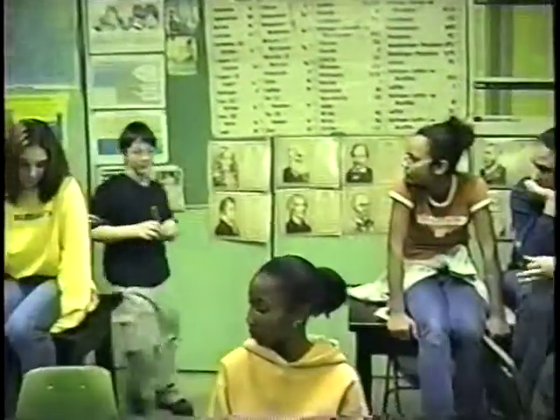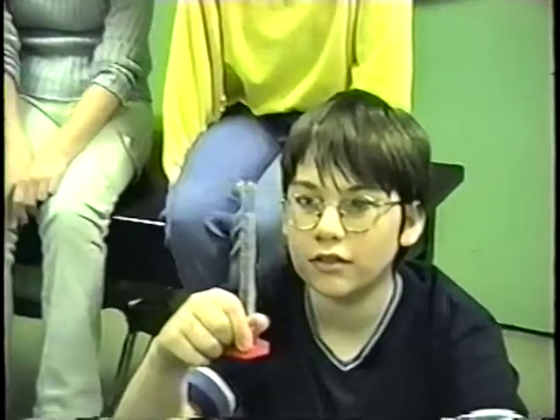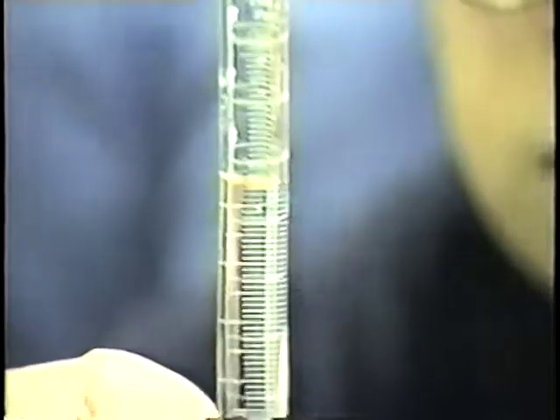Okay, David, are you coming back to us? He's hijacked over there. Okay, so he's going to be reading the lowest part. Now, David, I need you to lift that up at eye level. I'm going to try to zoom in to see if we can actually see the meniscus here. Where is the water now, David? Oh, I see it, okay. All right, now, at eye level, can you tell us how much liquid is in there? 7.8. 7.8, okay, and that is in milliliters.